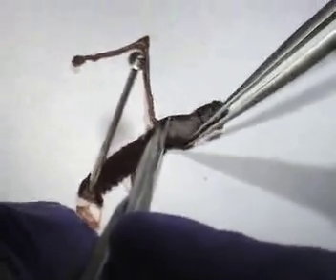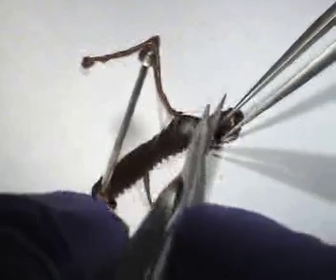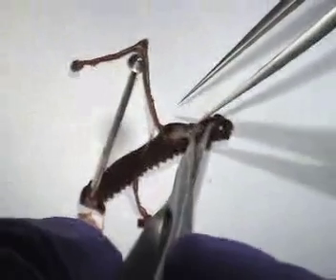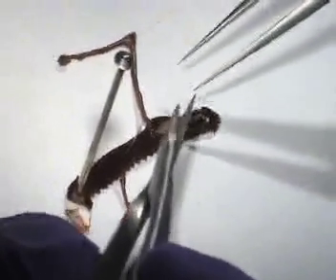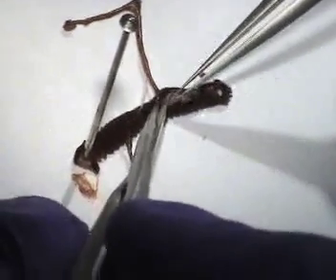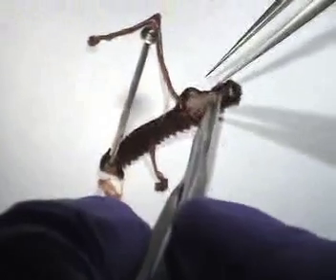Oh yeah, it's a female! Look at that — it's a female. Let's see, does it have any children? Let's name her Georgiana. I'm going to email him tonight and say we just dissected Georgiana. We should email him and say yeah, lots of little Georgettes. We could put the video on YouTube and give him a link.